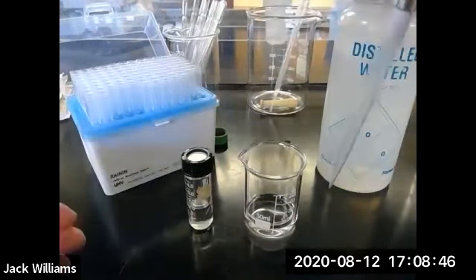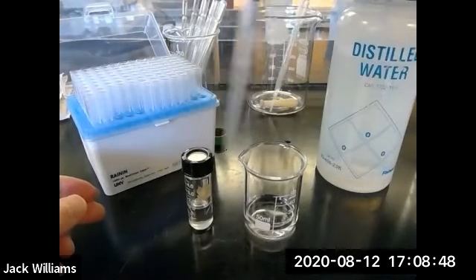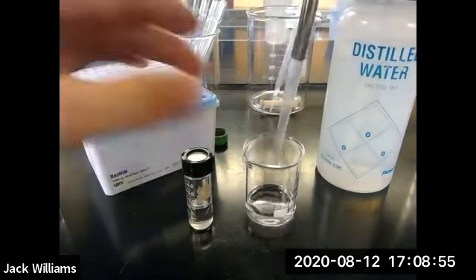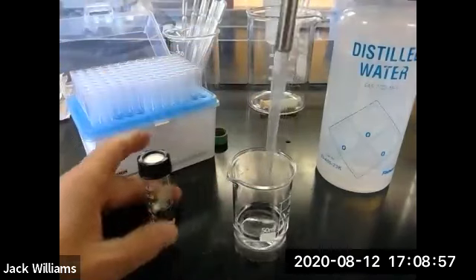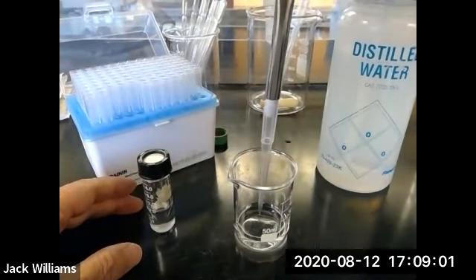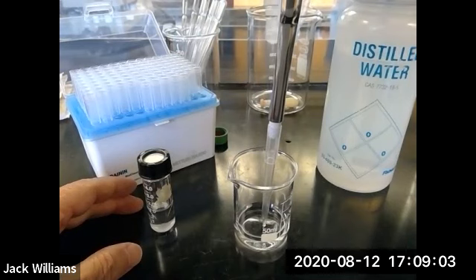We're going to get ready, and I'm going to go through a test. Notice that it's perpendicular to the desktop, not on the side. You never want to pipette like this. You're pipetting like this, right? So we're going to practice. To the first stop, plunger down to the first stop, below the liquid, draw it up slowly.